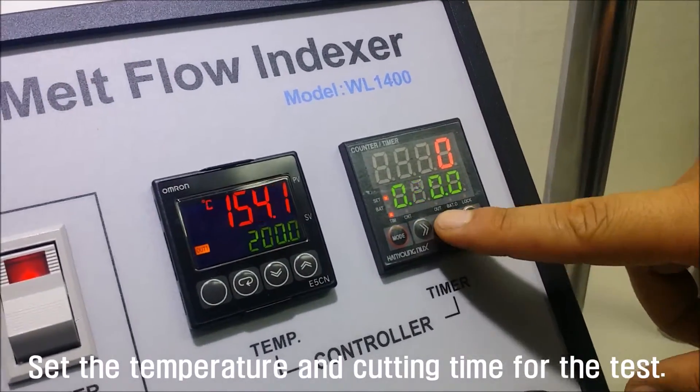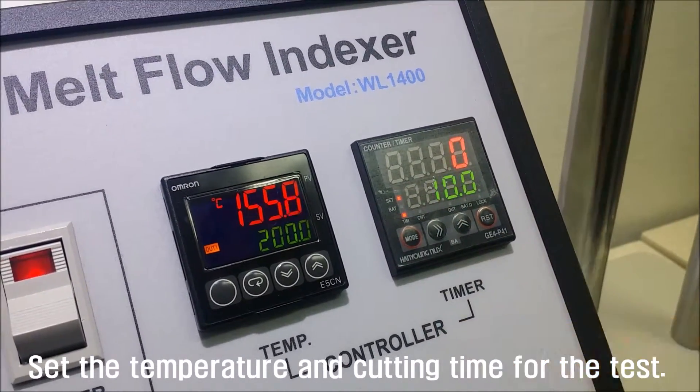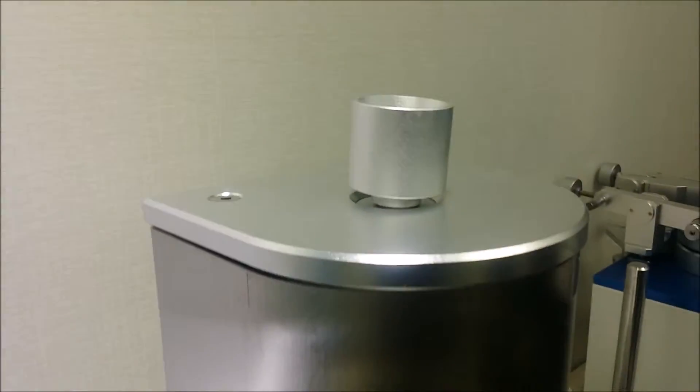Set the temperature and cutting time for the test. Wait for the tester to get heated.